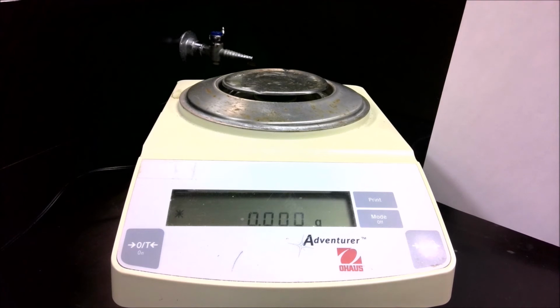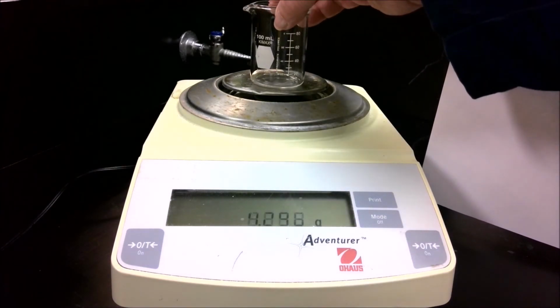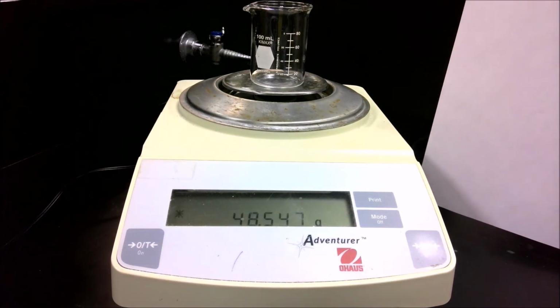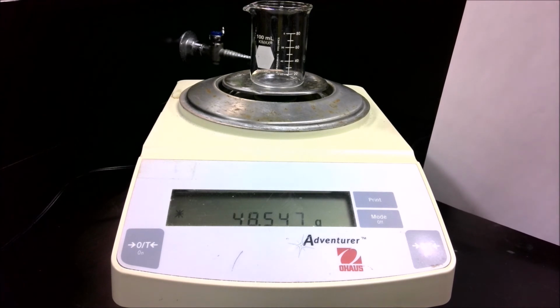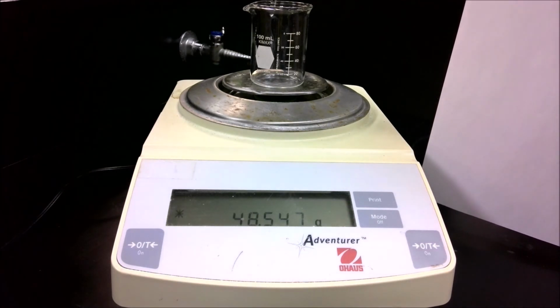All right, trial 2 of the density of water. Once again, we start by measuring the mass of the empty beaker. I then use my pipette again to get 5 milliliters of water. So let me prepare that. And now I add the water to the beaker.